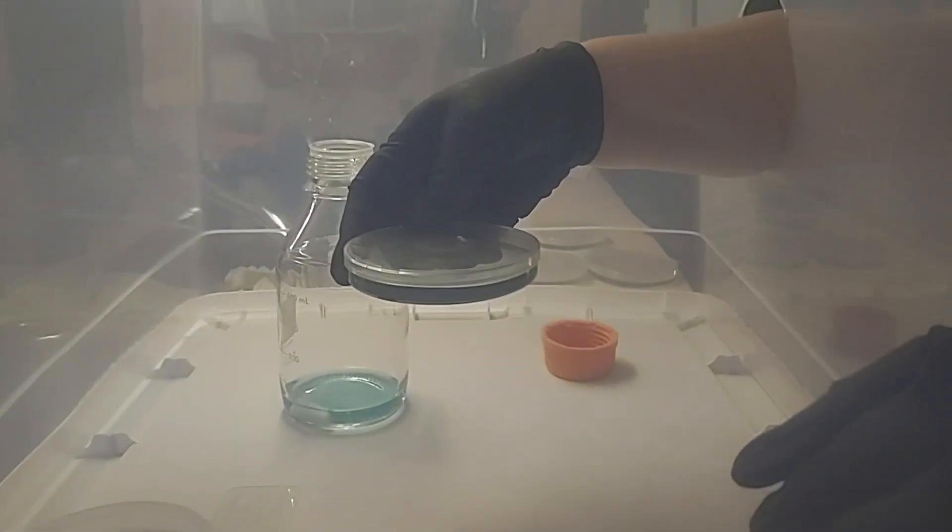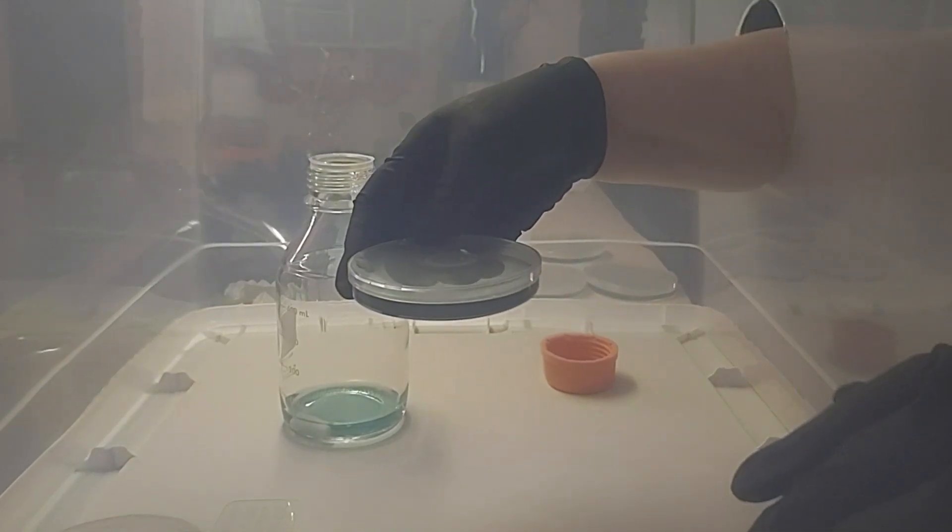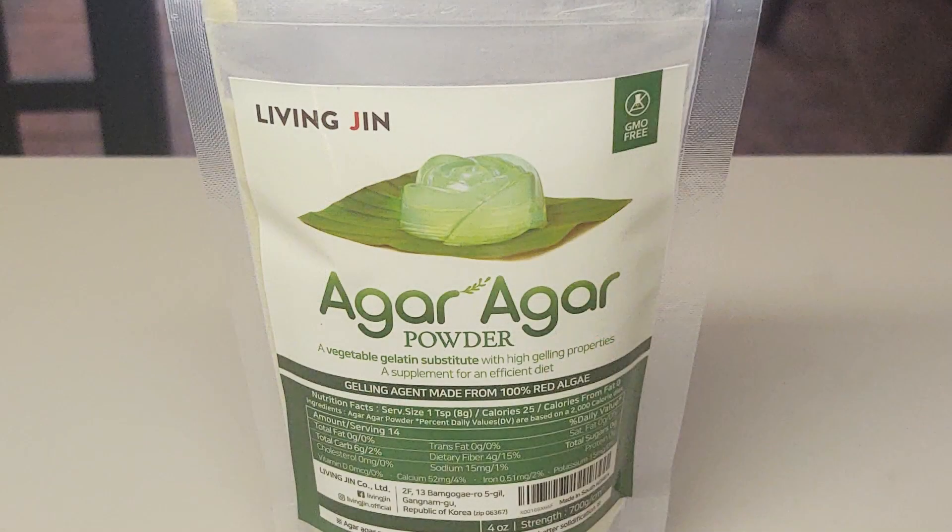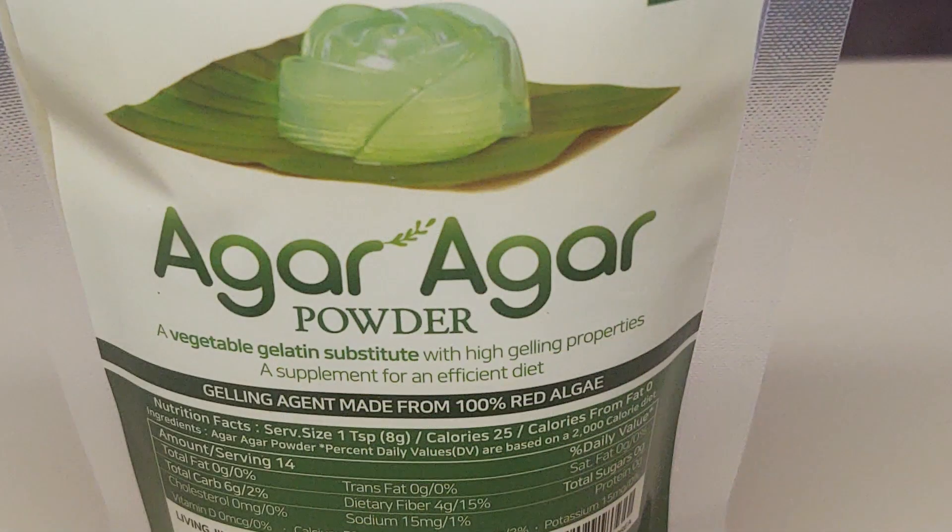In this video we are utilizing water agar to complete a spore to agar transfer. Spores are inherently dirty so using water agar without the nutrients and sugar will rob contaminants while allowing good mycelium to grow.